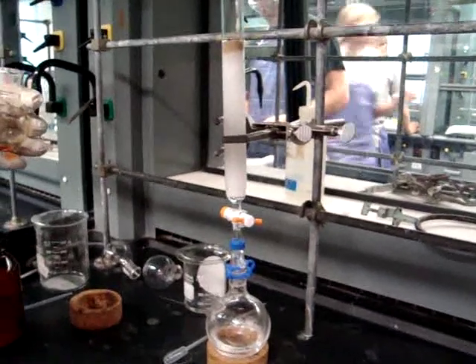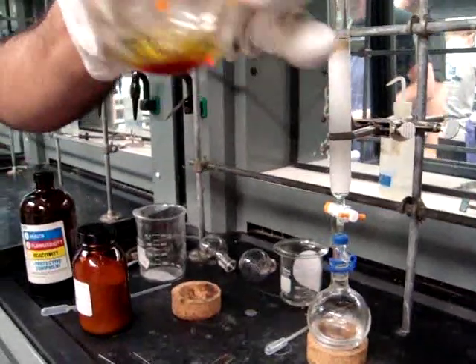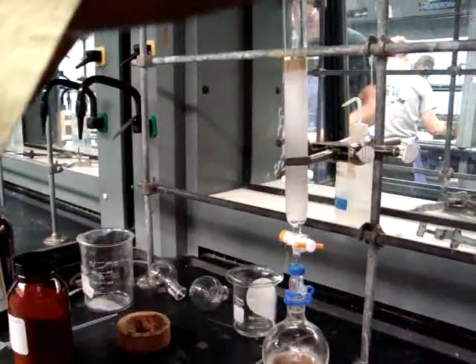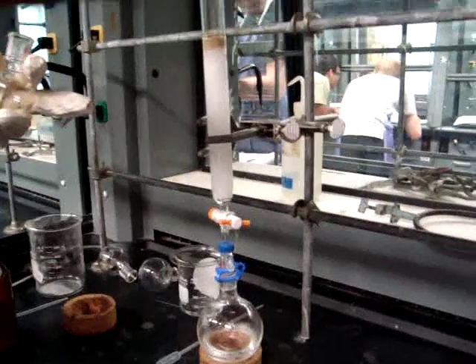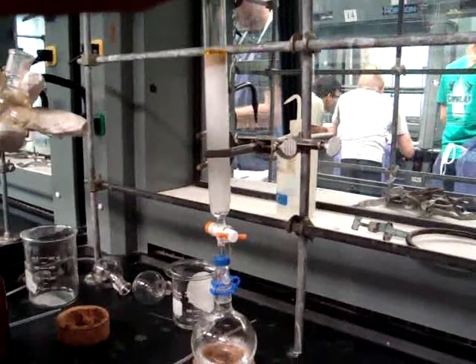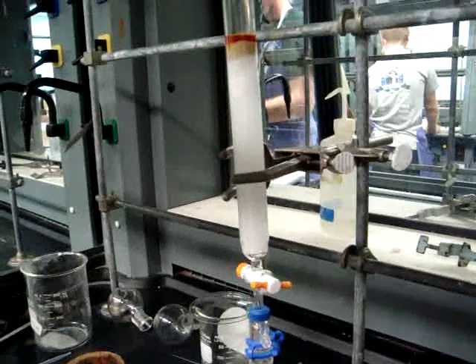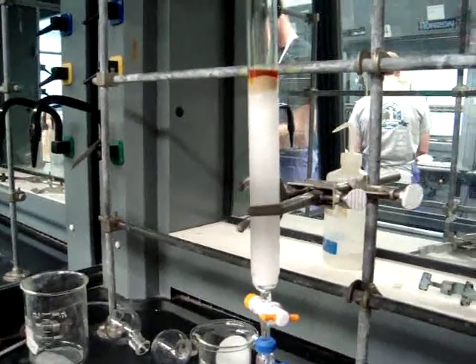Add 0.5 milliliters of pet ether and 0.5 milliliters of dichloromethane into the flask with the pigments. Then, using a pipetter, carefully add the pigment solution to the top layer of the column, focusing down the center and not the sides. You want the pigments to form a band in the column. Make sure the stopcock is closed and the vacuum is either off or removed while loading the column with the pigments.